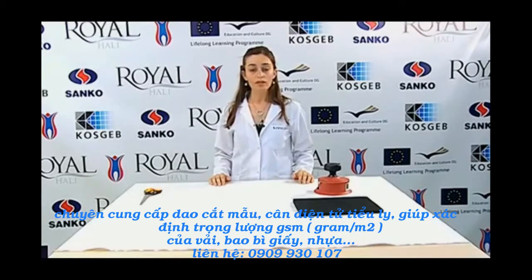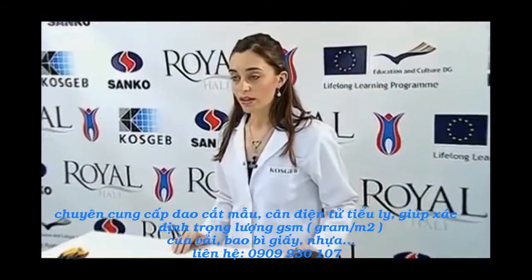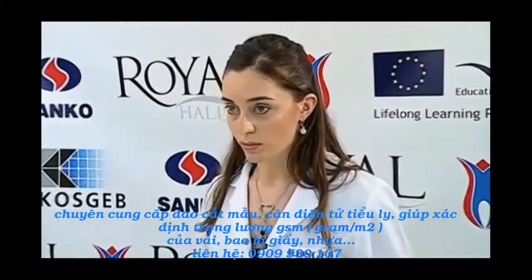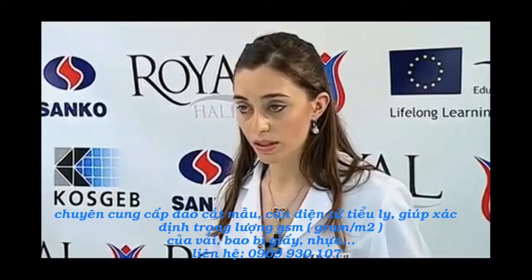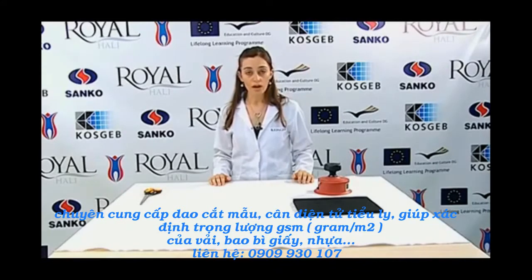There are several methods when determining the mass per unit of the fabric. Thus, all the methods should be examined carefully and the most suitable of all should be chosen. However, it should be kept in mind that none of these methods is absolutely superior to the others in terms of accuracy. This test is applicable to fabrics that are produced in the form of rolls or pieces. As mentioned, the determination of the mass per unit can be done via different methods, and today we are going to determine the mass per unit with small samples.